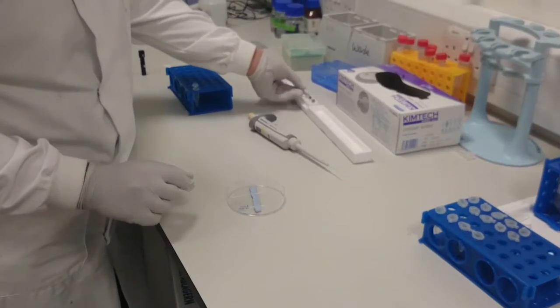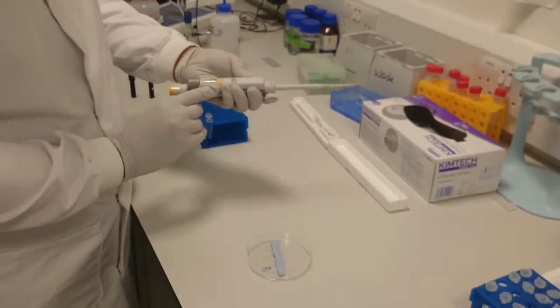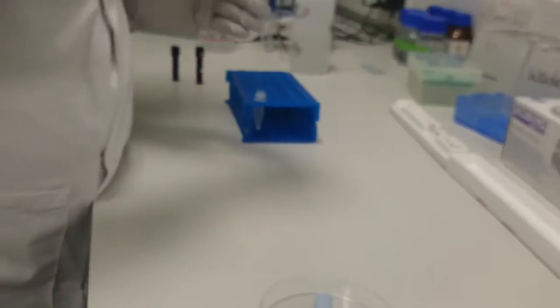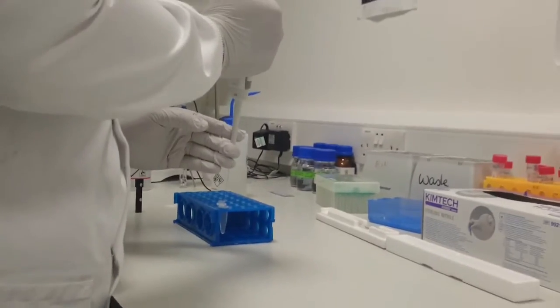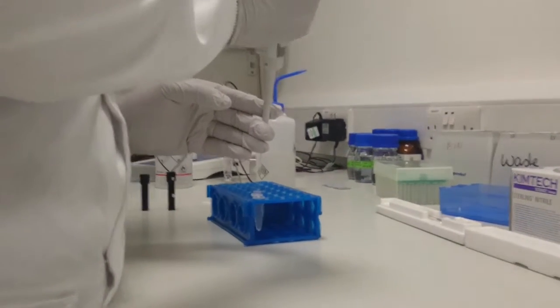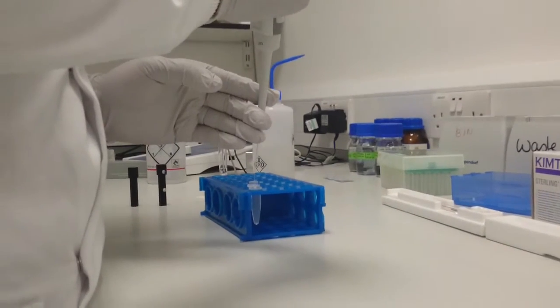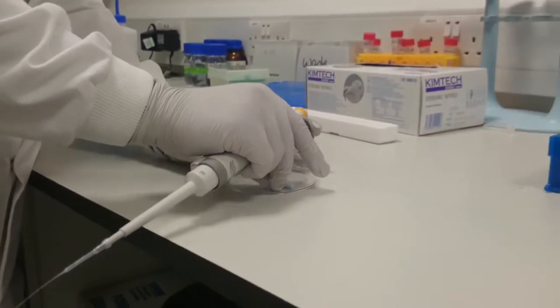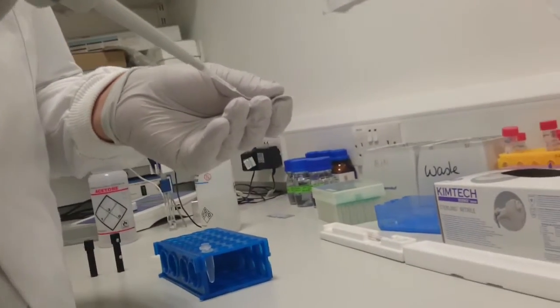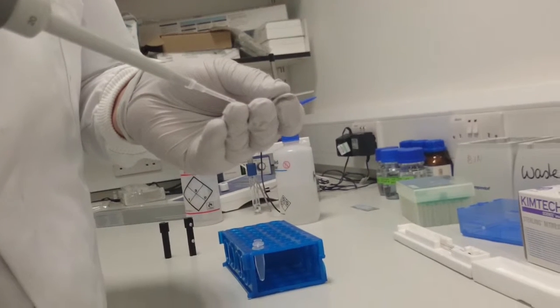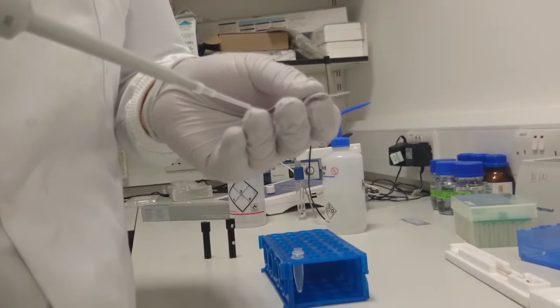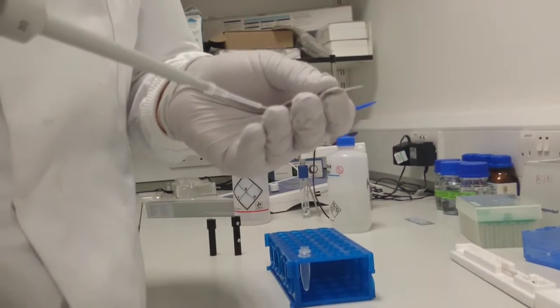The other method is to use the gel loading tip. Here, set your pipette between 10 and 12 microliters. Press the plunger and suck up the fluid. Wait a few seconds, as the capillary action takes a while. And then as before, take your pulled tip, place the end of the capillary with the needle, and press the plunger slowly. And again, when you see the liquid start to appear, pull back. You're only filling the end.